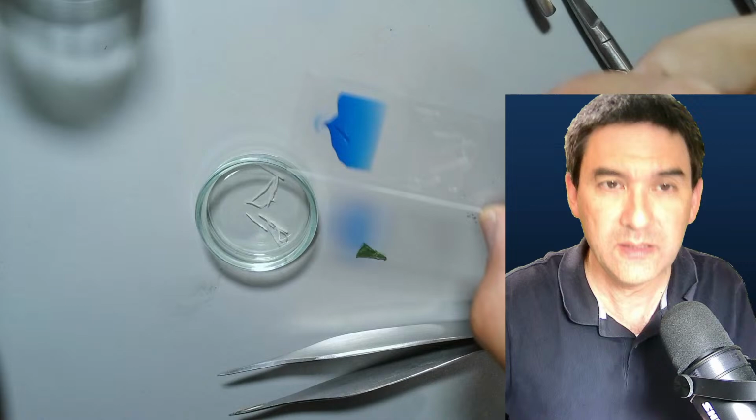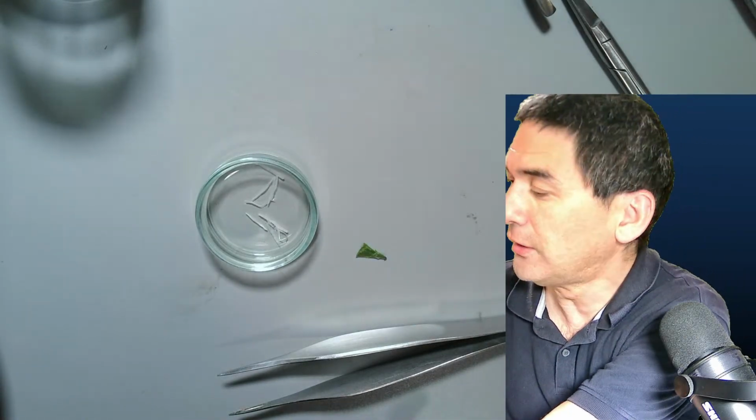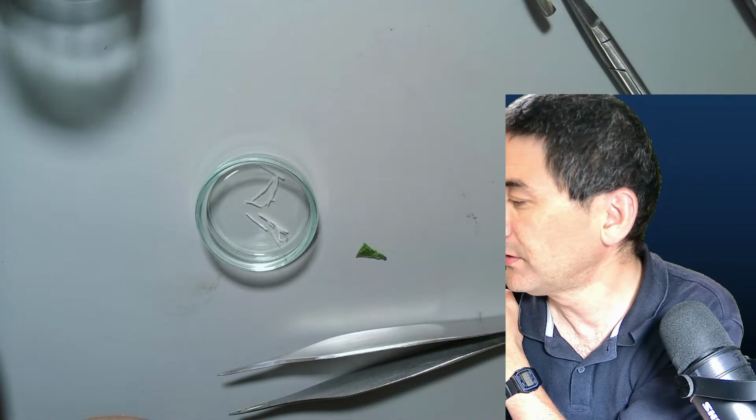Okay, still seems to be quite a thick one. It asks here how many percent alcohol I used. I think 96% alcohol. It's just the regular one, as it came directly out.